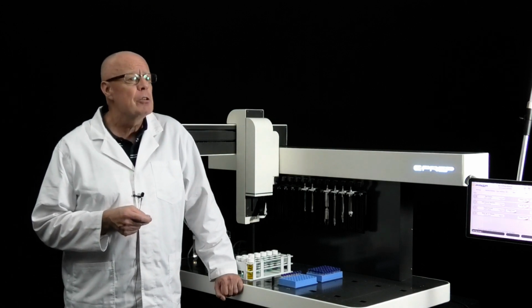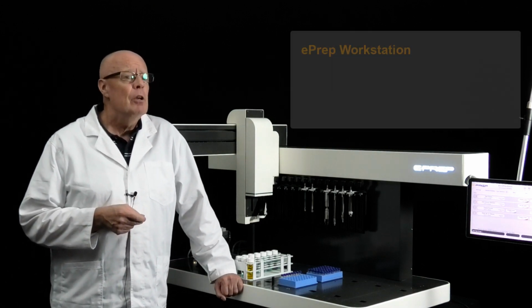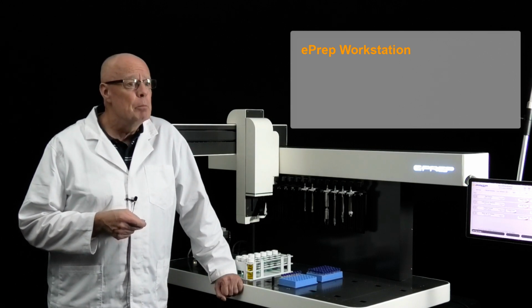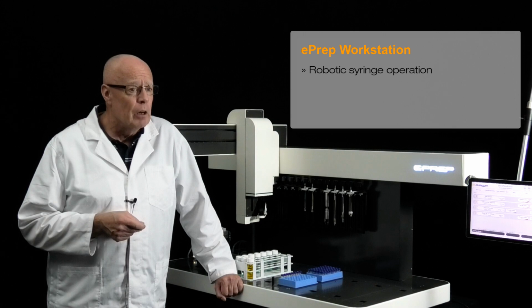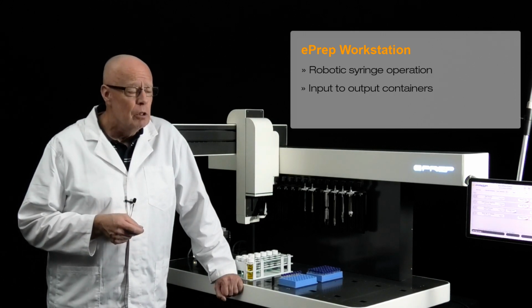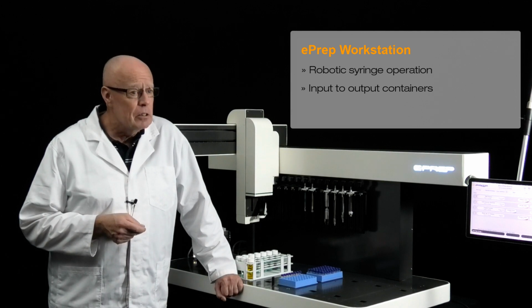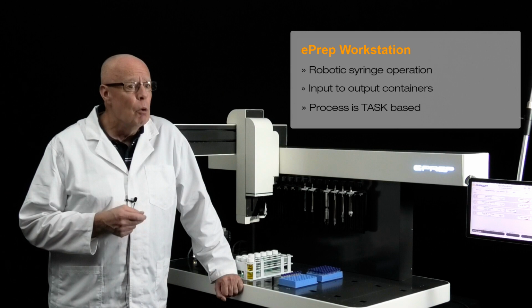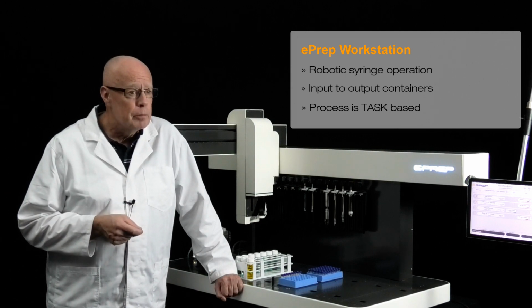The ePrep workstation is essentially a robot which uses a glass analytical syringe to move a liquid from an input vial to an output vial. How the ePrep delivers the liquid between the two, we call this a task. This simple concept can be extended into more complex sample preparation.